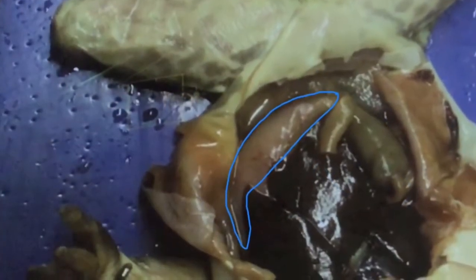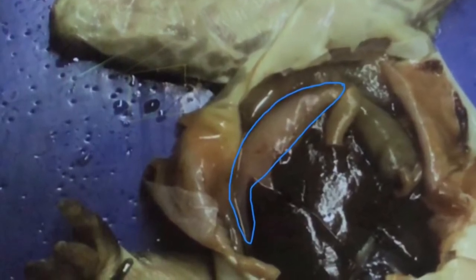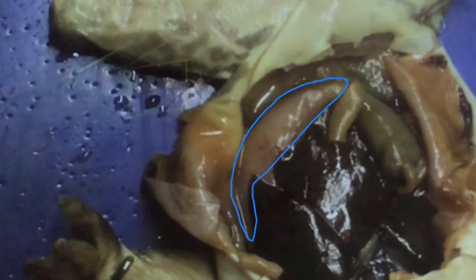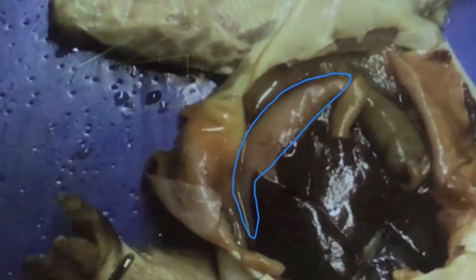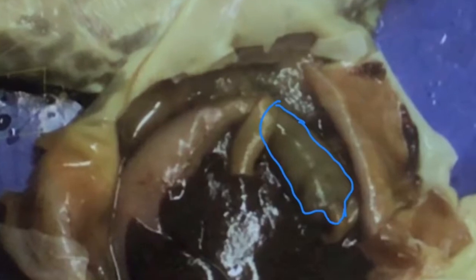The stomach, which is usually found in a crescent shape, secretes acids and enzymes that digest food. Periodically, it also contracts its muscles, which churns the food in order to enhance the digestion. The large intestine, also known as the colon, is the last part of the gastrointestinal tract. This tract is very important for the body as it is responsible for excreting the remaining waste from the digestive system. The tract is also responsible for taking in necessary nutrients for the body.